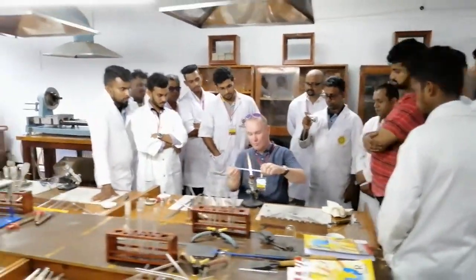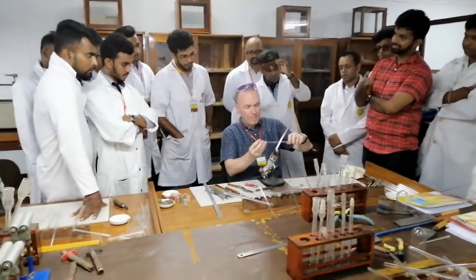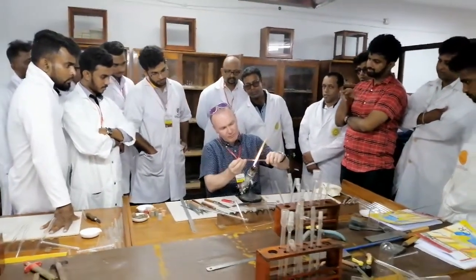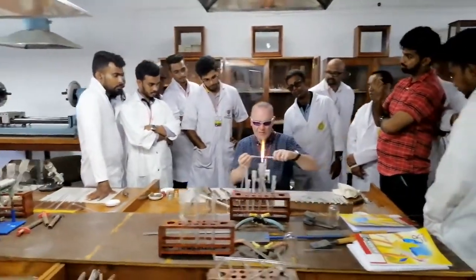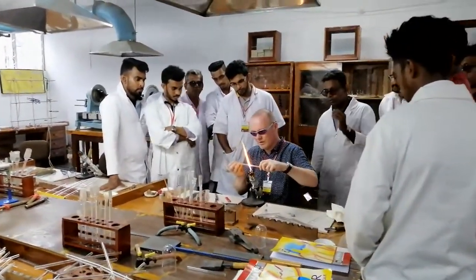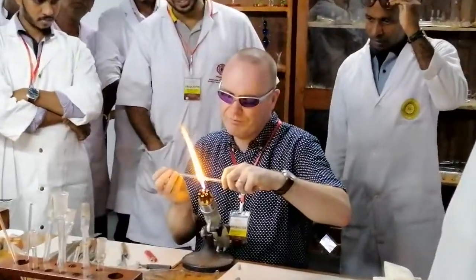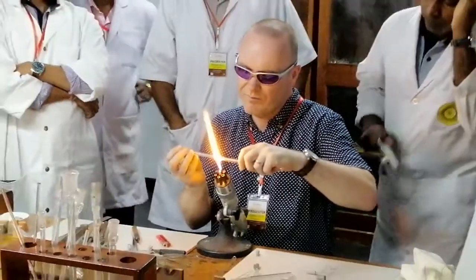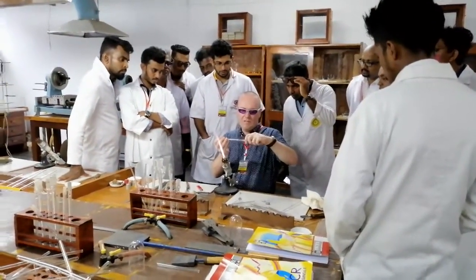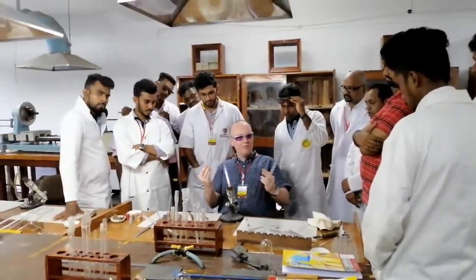The yellow — then I have the glass, so that's all the glasses in the flame. You can see there that I've just got the underside of the glass in the flame. And then, very slowly, pushing together. So, because we're really hitting the underside, it means we can push a little bit more.